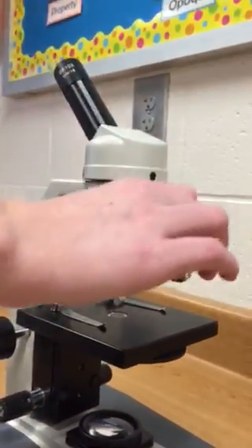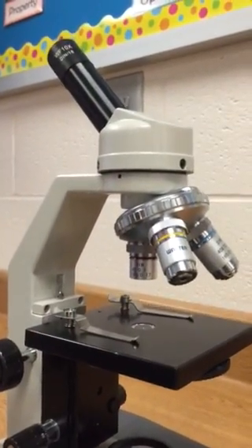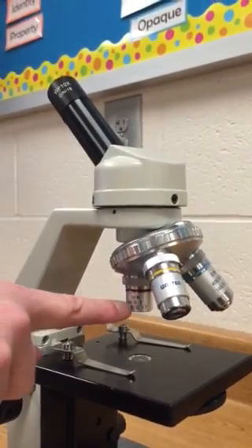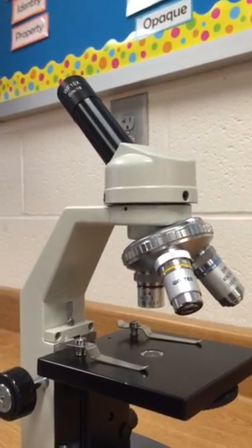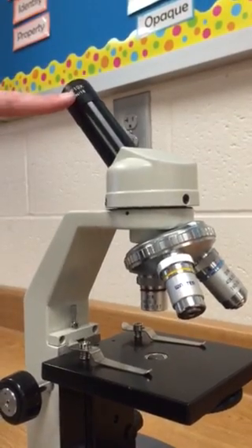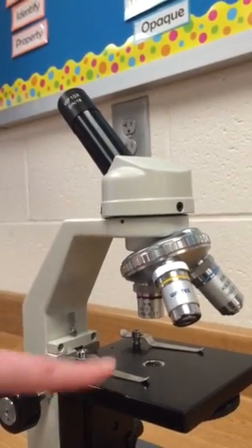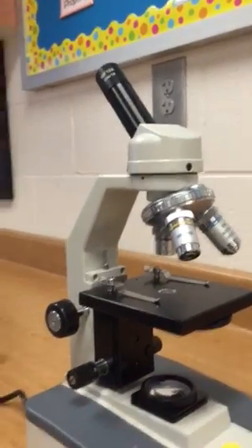So for example, if I'm looking at a specimen under low power, I am not looking at it only four times. I need to remember my eyepiece is ten times and my objective is four times. Do I add them, subtract them, multiply them, or divide them? I need to multiply these numbers together, which gives me forty times — so I'm looking at an object under low power at forty times magnification. Much bigger than I see it with my eye.